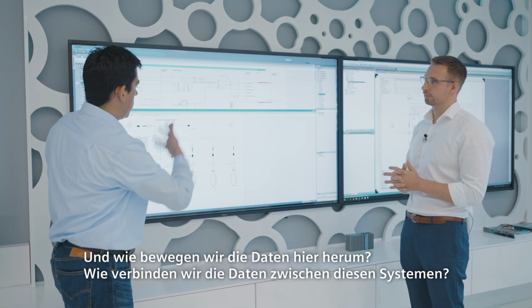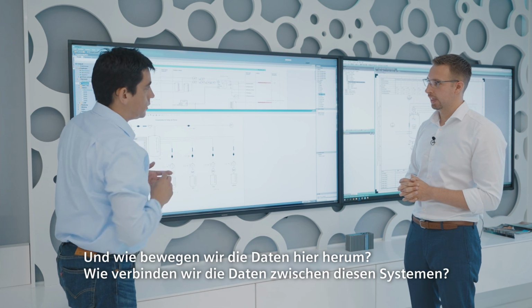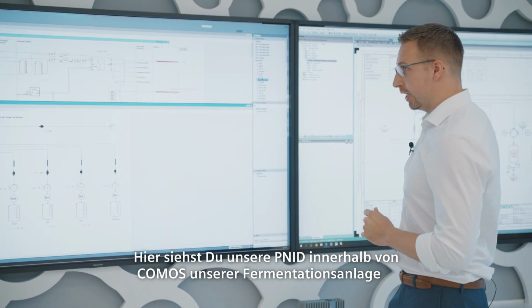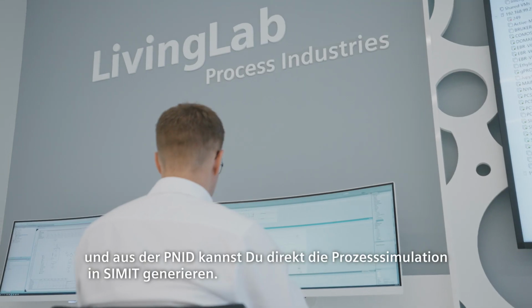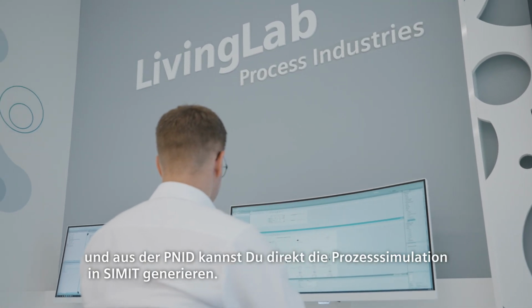And how are we moving the data around here? How are we connecting the data between these systems? What you see here is the P&ID inside of COMOS of our fermentation plant, and from the P&ID you can directly generate the process simulation inside of SIMIT.